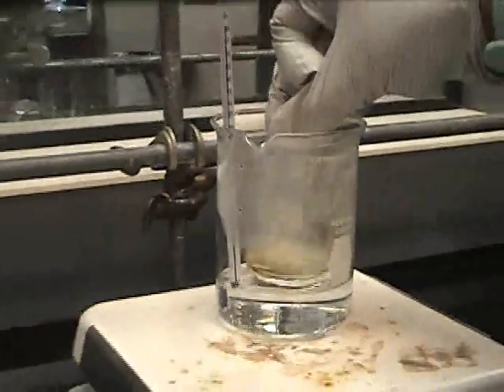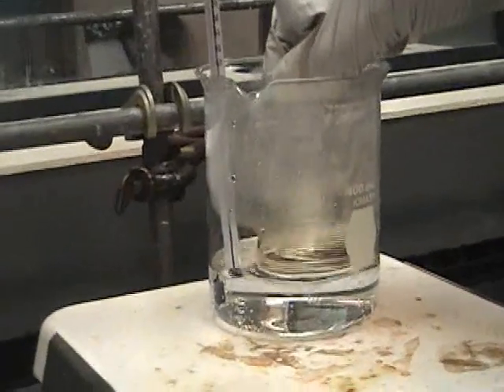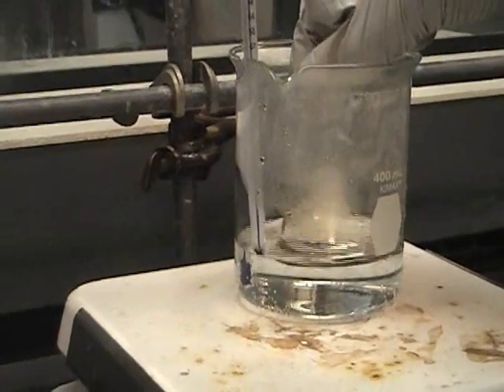After the mixture has been in the water bath for about 15 minutes, swirling occasionally, remove it and allow it to cool to near room temperature. It should take about 3 minutes.